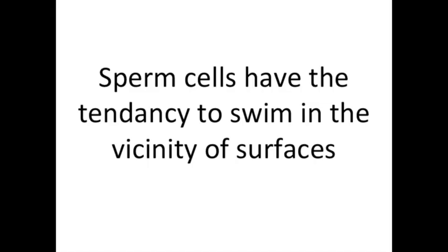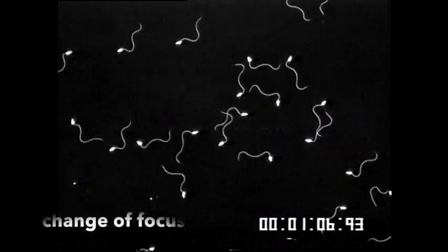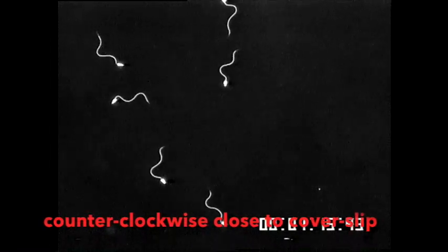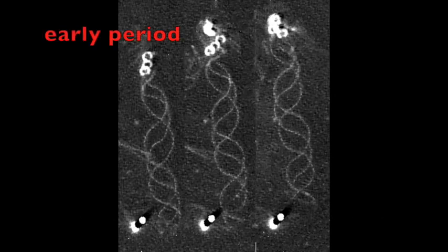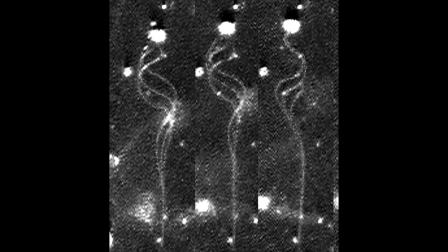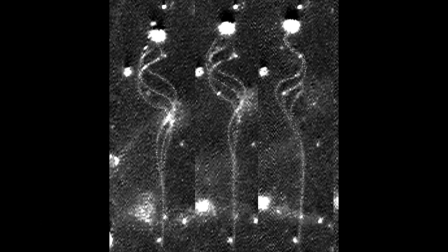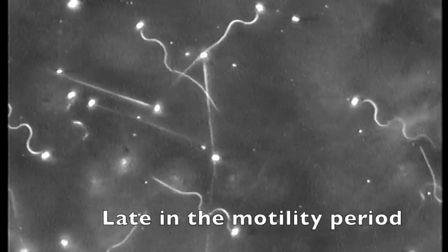Fish spermatozoa have the tendency to swim in the vicinity of surfaces. Fish spermatozoa swimming in the vicinity of a glass slide follow clockwise circles. But when changing the plane of focus, sperm swim in the vicinity of the coverslip and follow counterclockwise circling. During the motility period, the wave shape of fish sperm flagella changes. In the initial period, waves cover the whole flagellum, while in the late period, only the proximal flagellum is active.